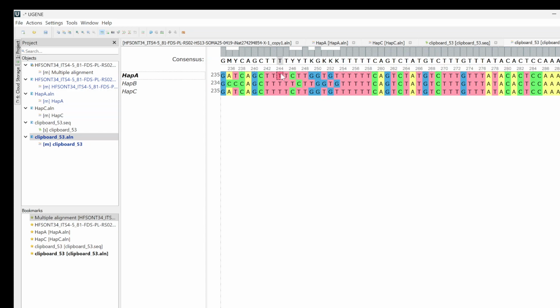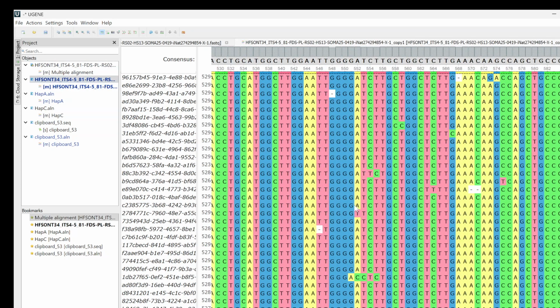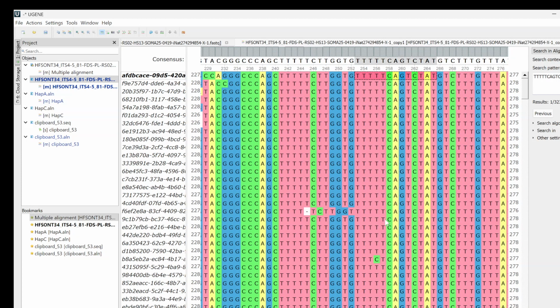But because these two haplotypes are actually missing that, it shifts the whole sequence over, right? You can see that, can't you? See? Everything's shifted over. So good thing I noticed that, and none of that's actually on the iNaturalist observation, but that's something to be keenly aware of. And let's look at that in the multiple alignment. And here's a way we can do that. I'll start from here and I'll select over there and I'll see what that looks like in the big alignment. Right here. Search for it, and it's going to take us right there.